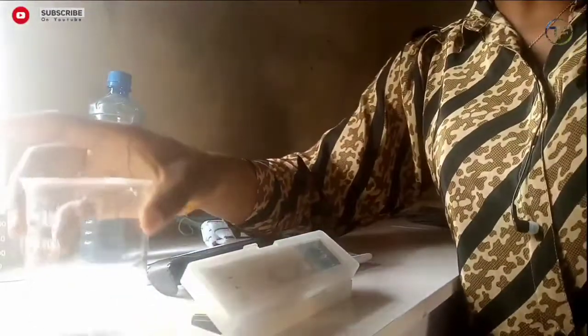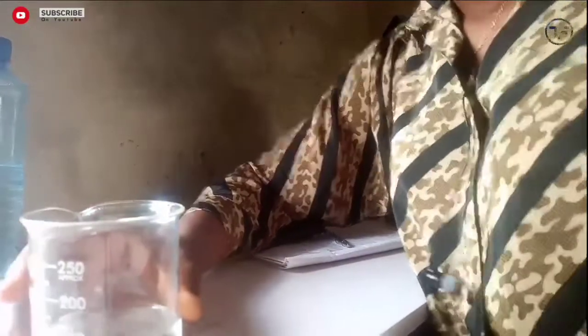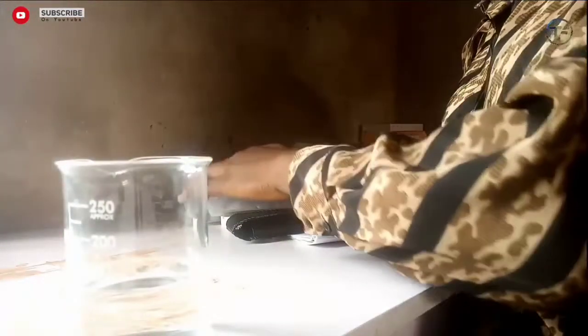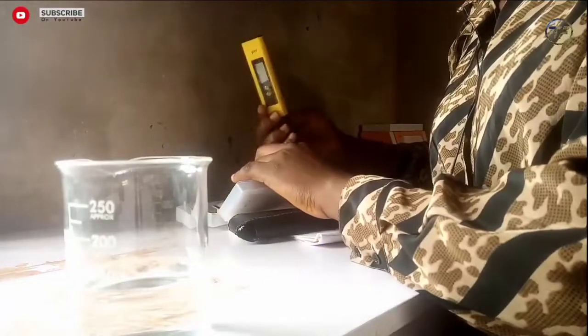I'm going to put this off now and proceed to testing our water. Here I have a beaker of water. I'm going to be checking the pH of the water first. My space is a little bit messy, but we're going to be checking the pH first. Here is my pH meter.